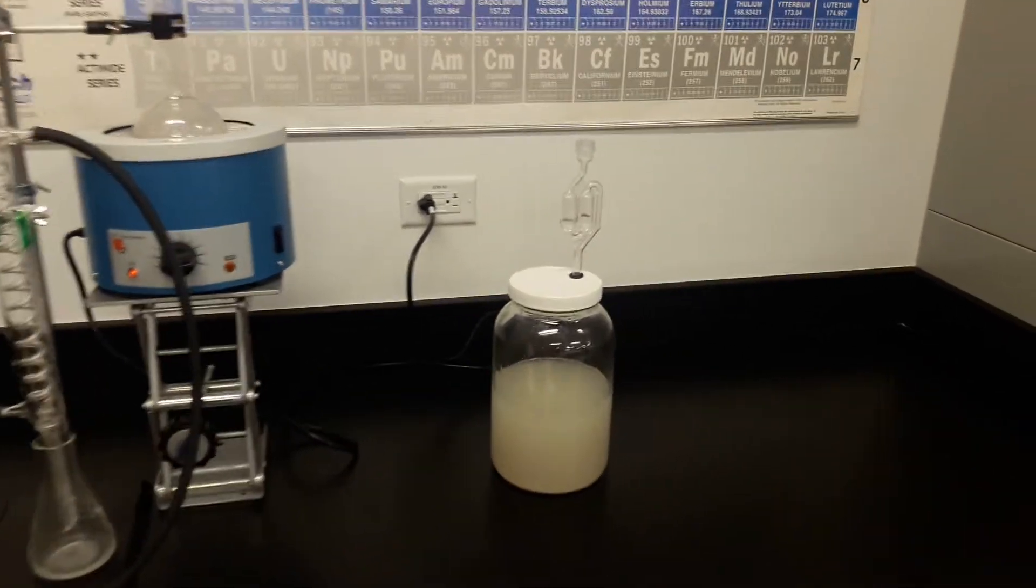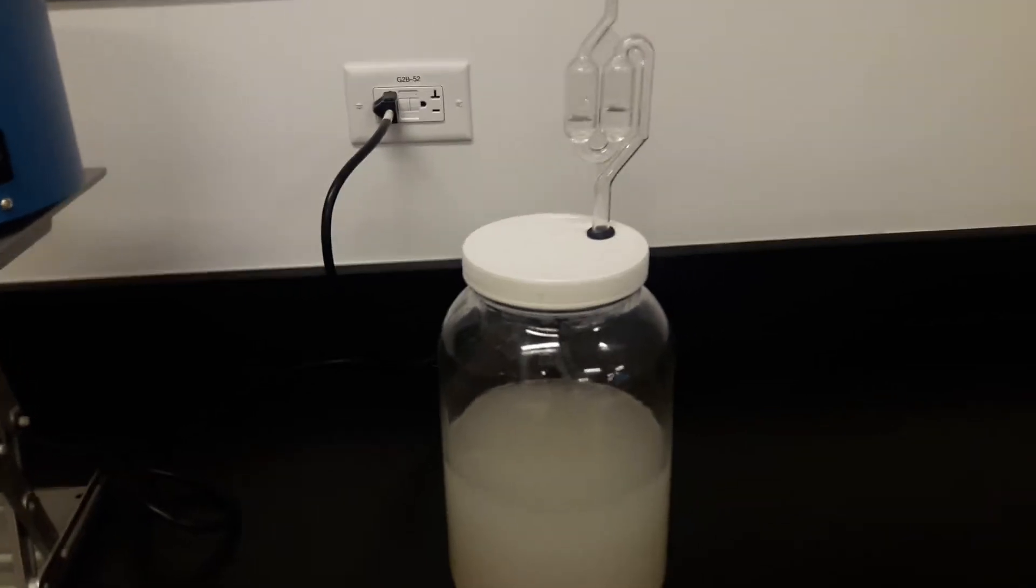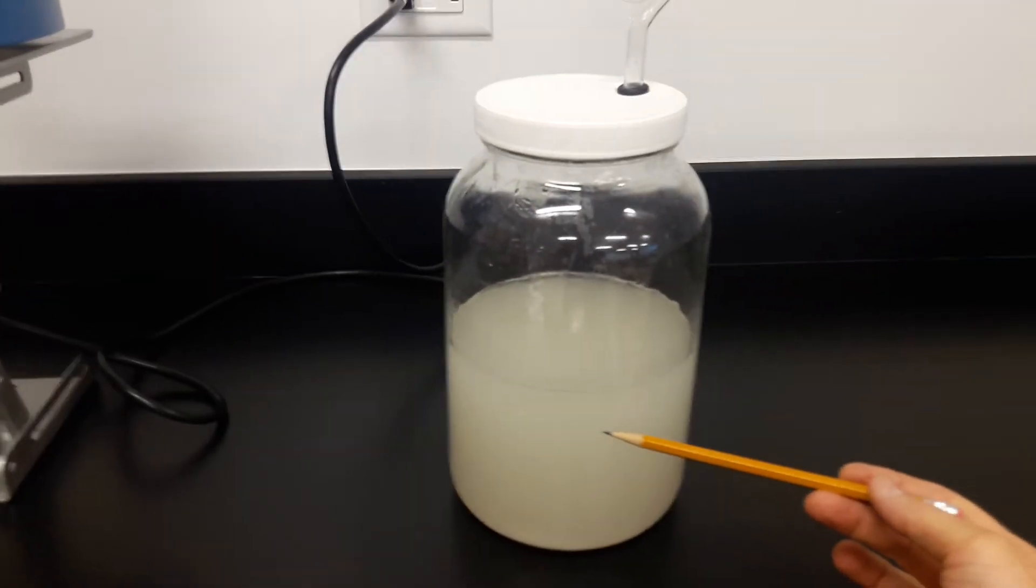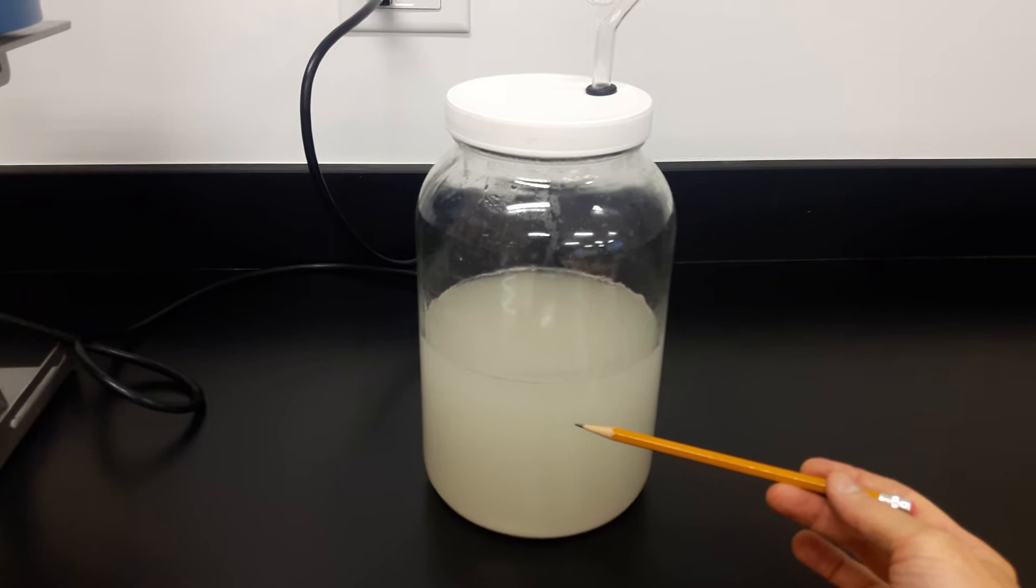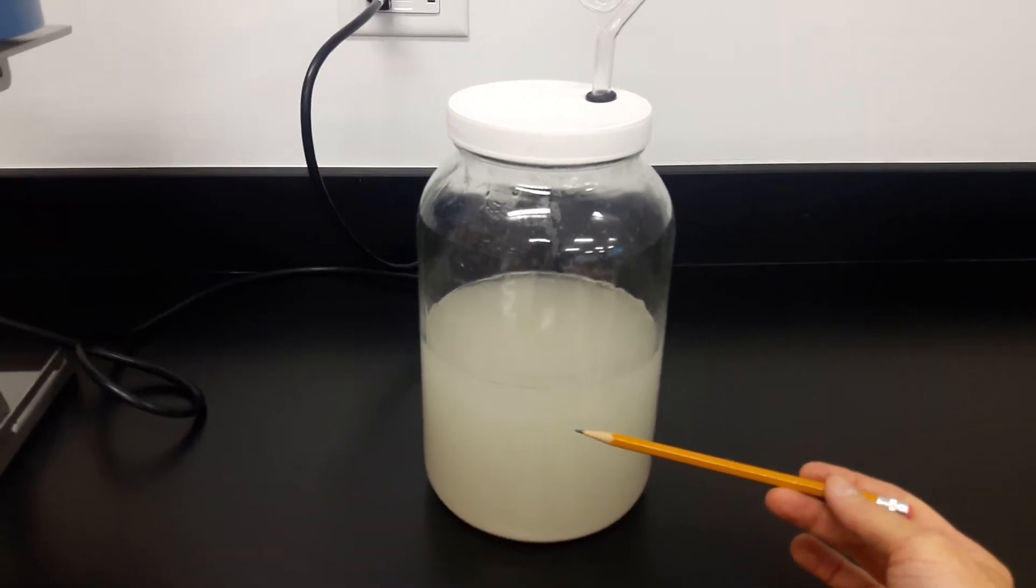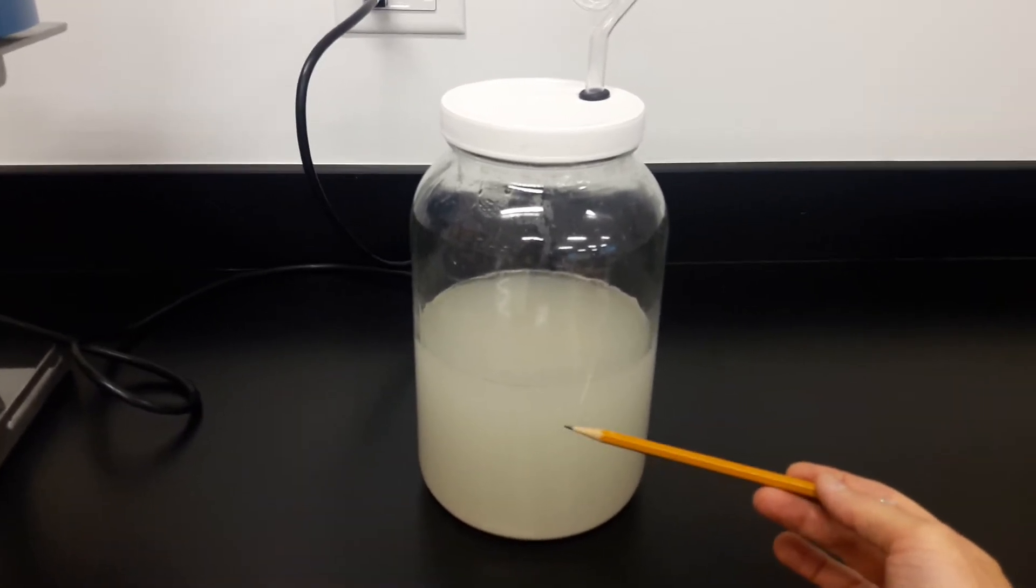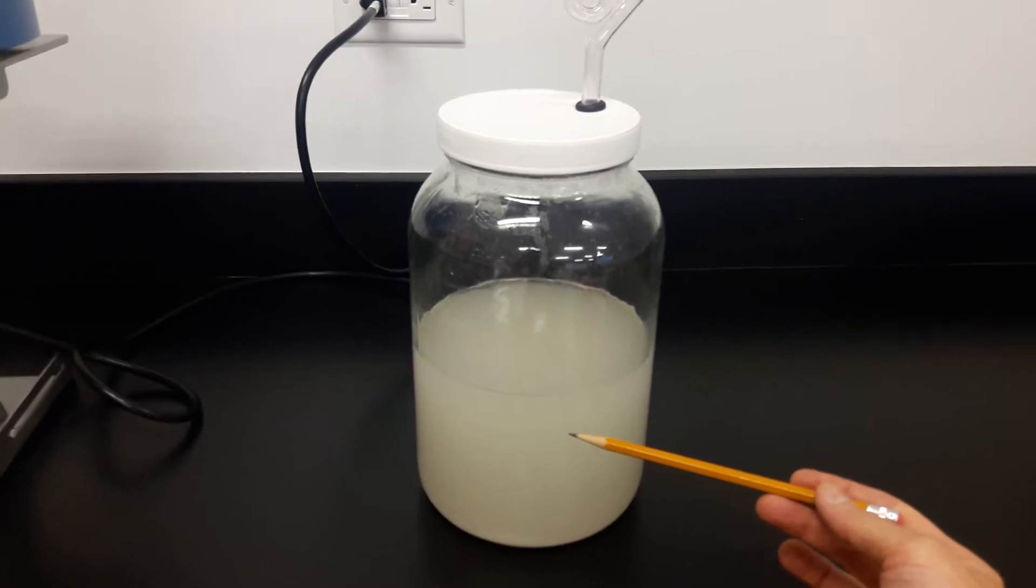During the week-long fermentation, the yeast have been consuming the sugar and producing alcohol and carbon dioxide. We want the alcohol to stay in the jar, but we don't want the carbon dioxide to stay in.